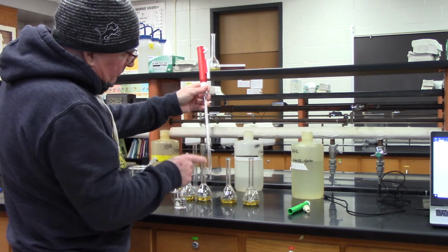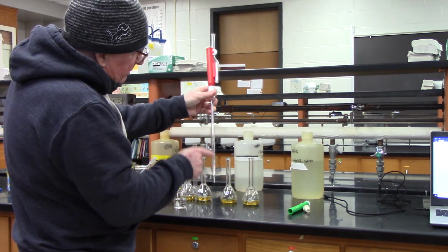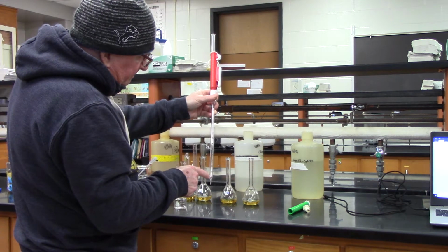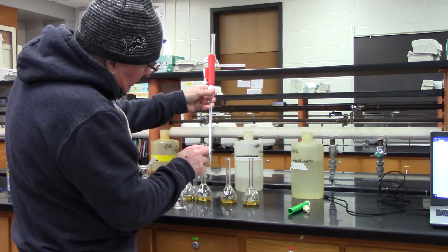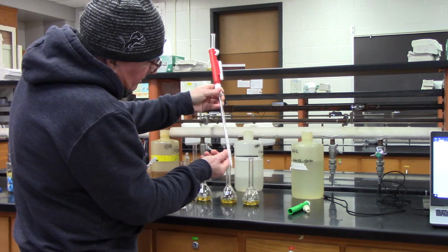Okay, so on the pipette, it has 2 ways of measuring. If you want to let out a certain amount, you raise it up to 0 and so forth. So I just want 2 mils, so I can measure up to the 2 mil mark here. I'm going to measure up to 8, all right?